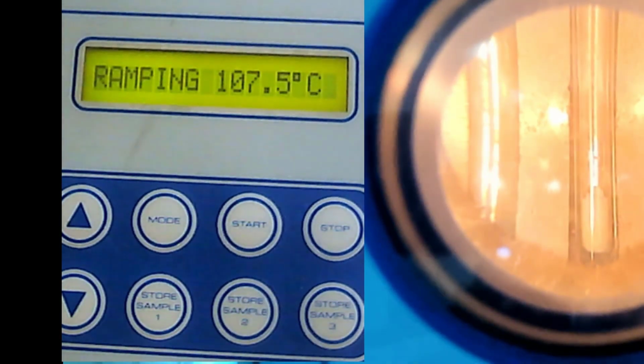Please observe. In the lab, if you are physically in the lab, you will start in front of the machine until it melts. It's the same thing. If you are in the lab, you need to look through the eyepiece until it melts. But what's worse is that during the physical time, you also need to see the temperature while looking at the eyepiece. But here you can see side by side.